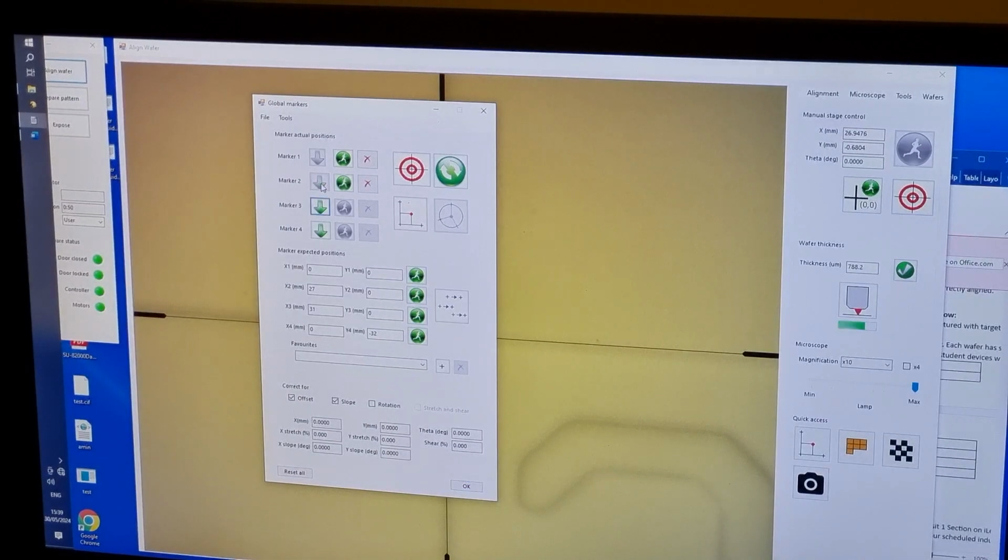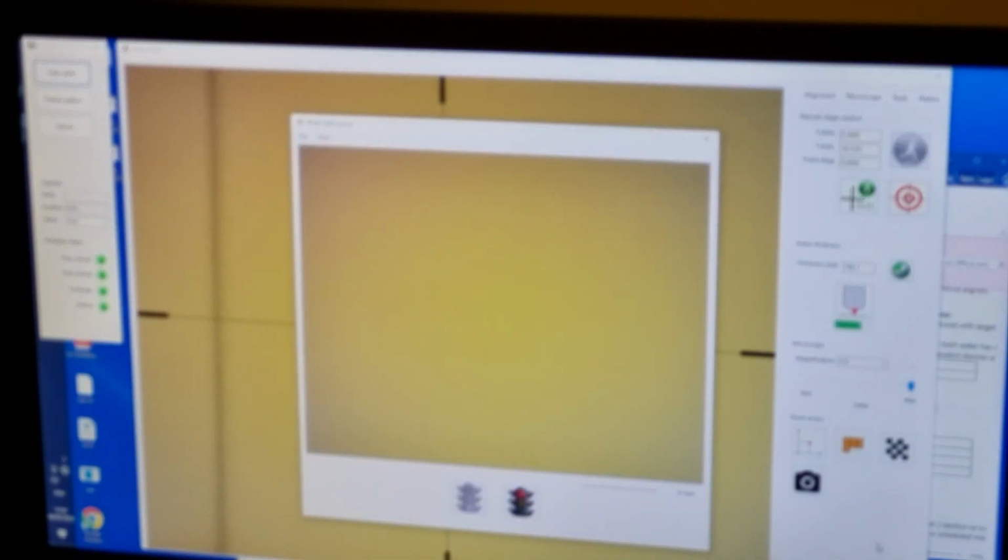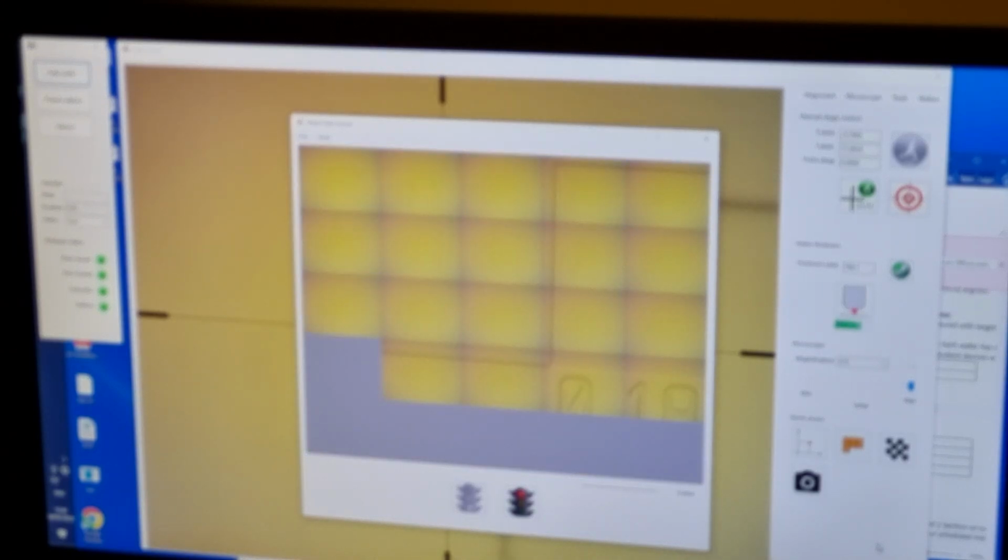Once again, launch the alignment window and drop the second marker under actual position and record its expected position below as 27X and 0Y. Move the microscope to the expected position of the final alignment mark by typing coordinates into the Manual Stage Control. Run the image tiling feature to help locate the center of the mark, place the crosshairs at the marked location, and launch the alignment window.